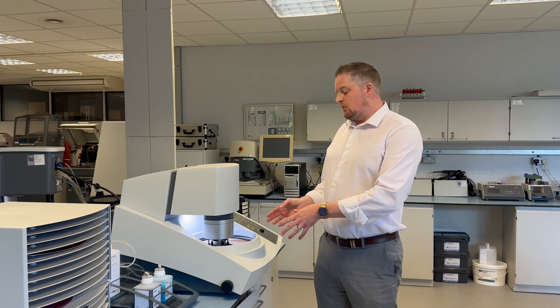Which means when we've got a finished sample, we're going to be looking at 10 and a half minutes from start of grinding, all the way through to the final polish. We're just getting to the end of the 3 micron step — this will be the final step. So after this, we would either etch or use OPS if you want to go on for further analysis.